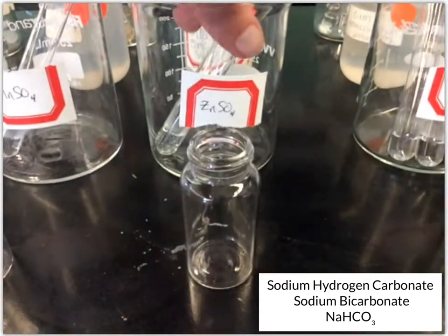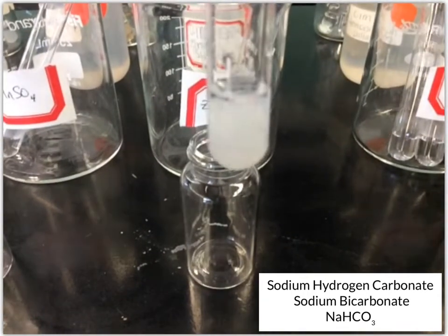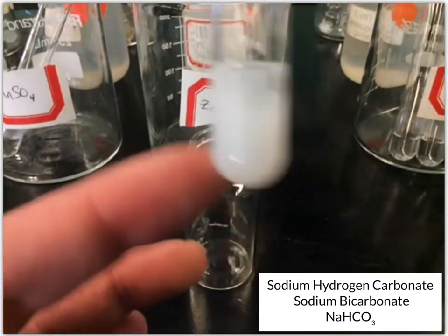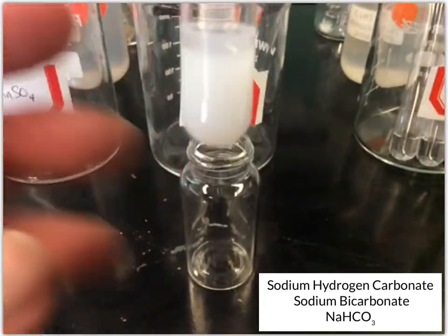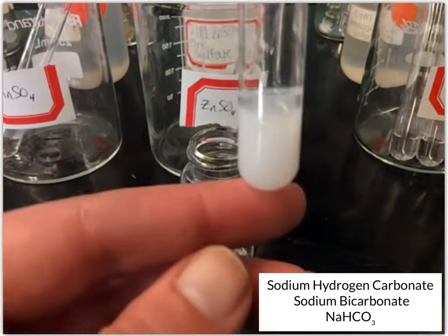Then we've got zinc sulfate. And this one also formed this white solution.